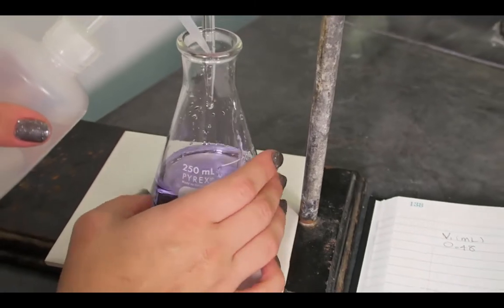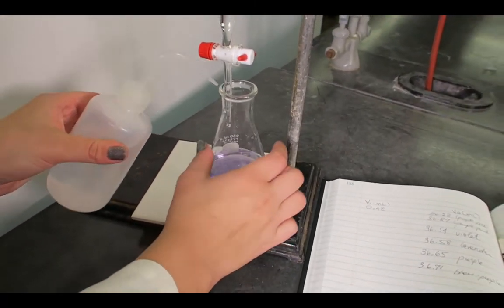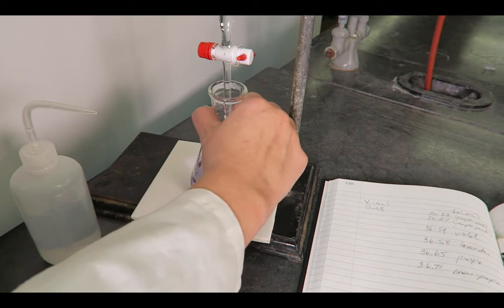Since the burette can read to 0.01 mL and a drop is 0.05 mL, splitting drops is helpful for accuracy.